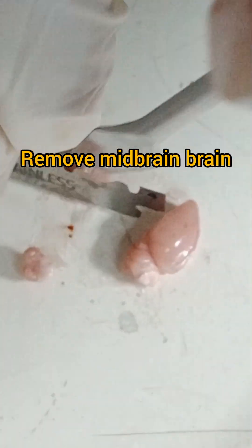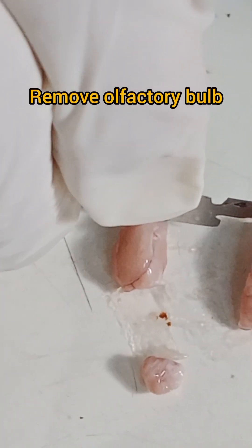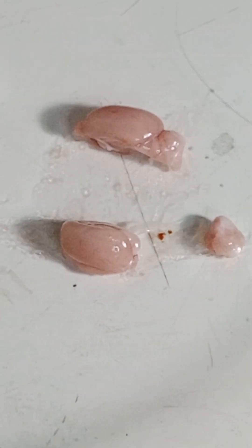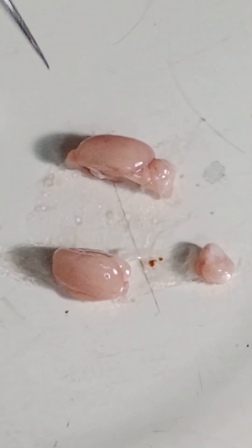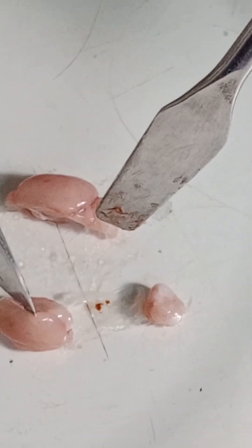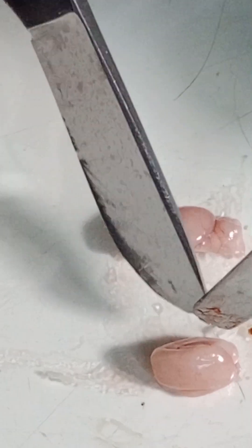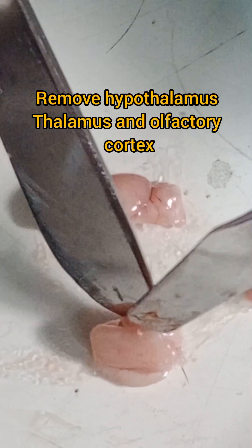From one part I am separating the midbrain, then I will remove the olfactory bulb. It is not an easy task because the mouse size is very small. I am using a petri dish here — this is the third advice: use a petri dish, because glass has very little resistance when handling these brain tissues.